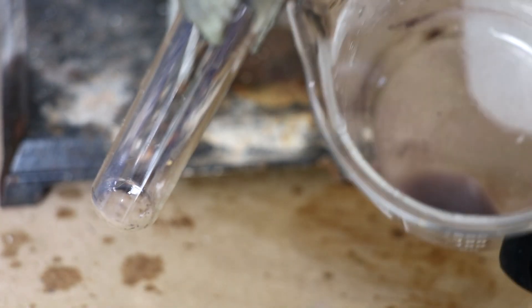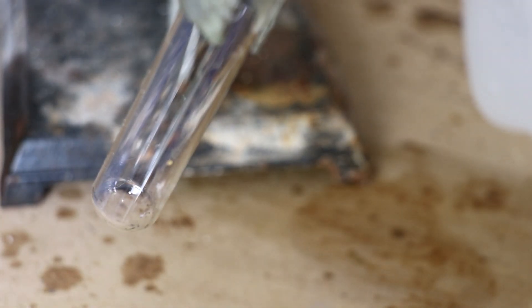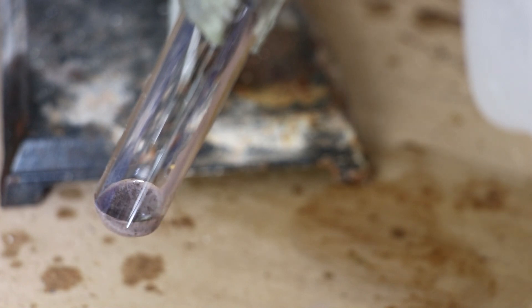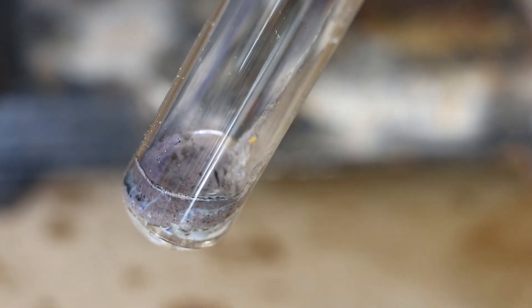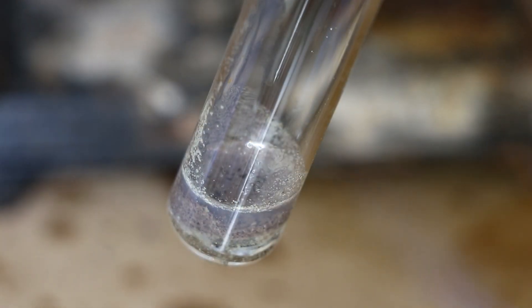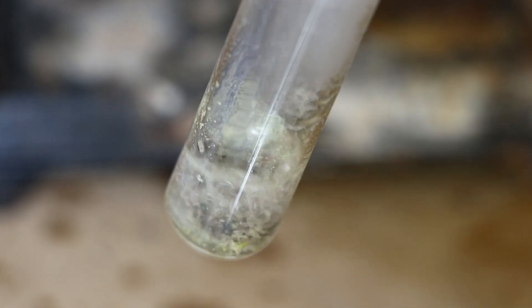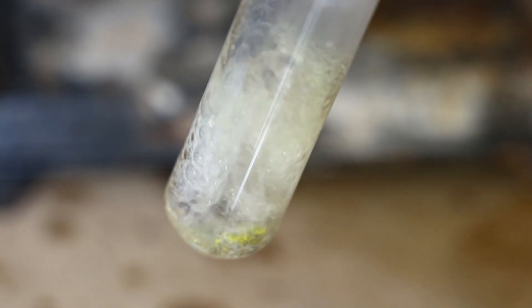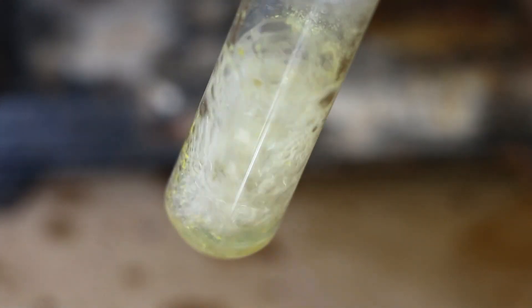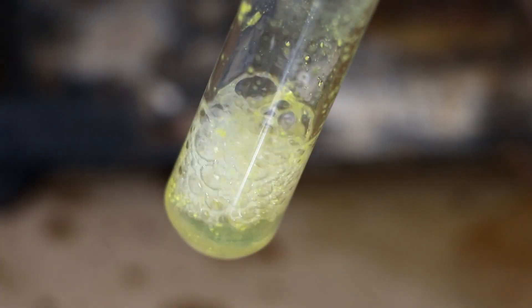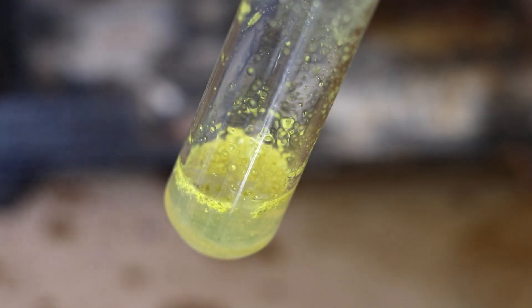Let's take some of the silver iodide that I poured off. And let's not add the sodium hydroxide to it. Let's just jump straight to sulfuric acid. In goes the acid. I don't see anything happening there. Well, it's turned back to yellow. Very interesting.